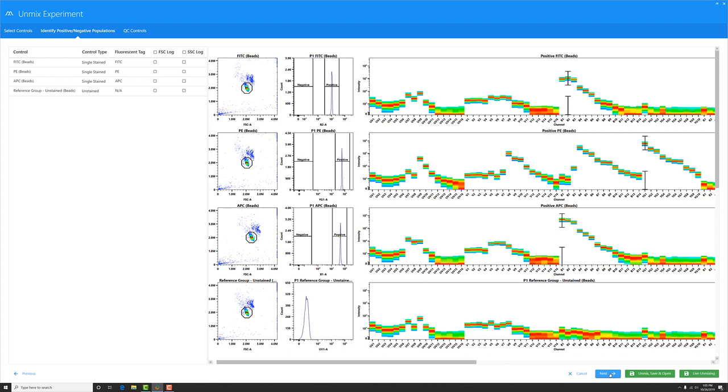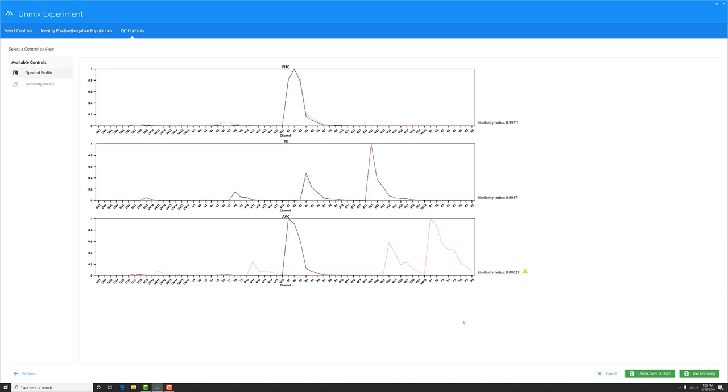I'm going to click Next to see what the QC controls has to say. When I look at my spectral profile overlays, where the control I ran today is compared against the benchmark control, I see again that for FITC, the overlays are pretty close and I got a very high similarity index score. Same for PE. But when I look at this APC tube, I can see visually these two spectra are very, very different, and the similarity index is also very low. So low that the software has flagged it that this control might not be the right one for your sample. Which indeed, it isn't. This is clearly not an APC in black here. This looks more like, say, Brilliant Blue 515.